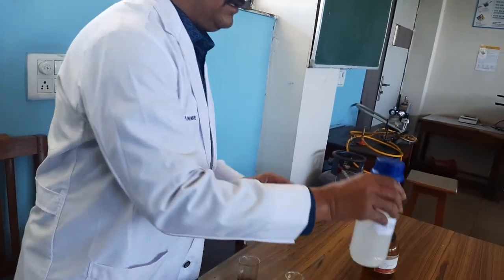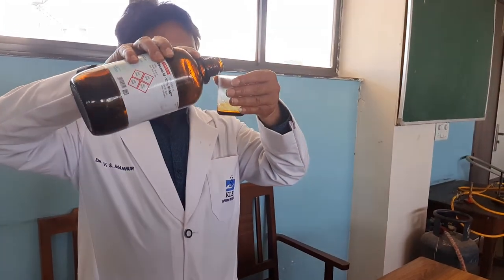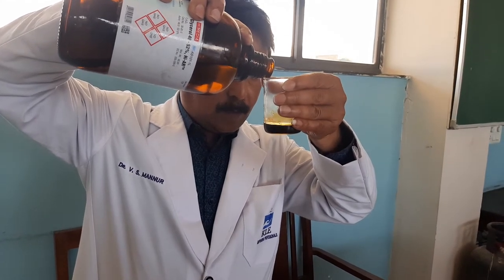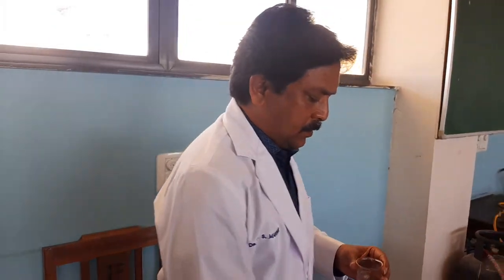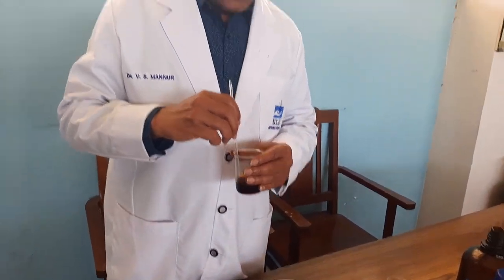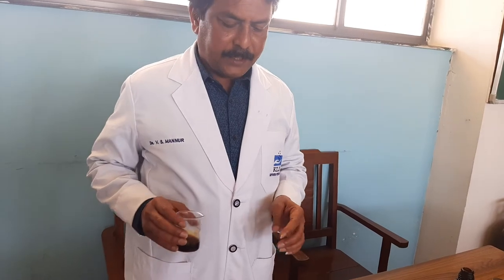Finally, take glycerin and add until the quantity becomes 25 ml. Now the quantity of the preparation is 25 ml. Mix the solution of potassium iodide, iodine, and glycerin until it is uniformly mixed. Now this preparation is ready for filling into the container.